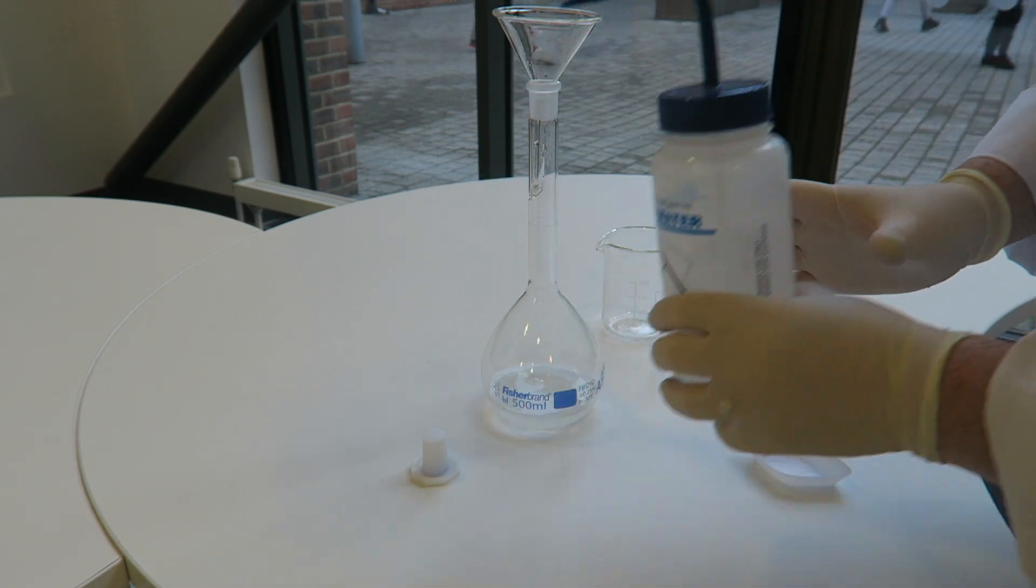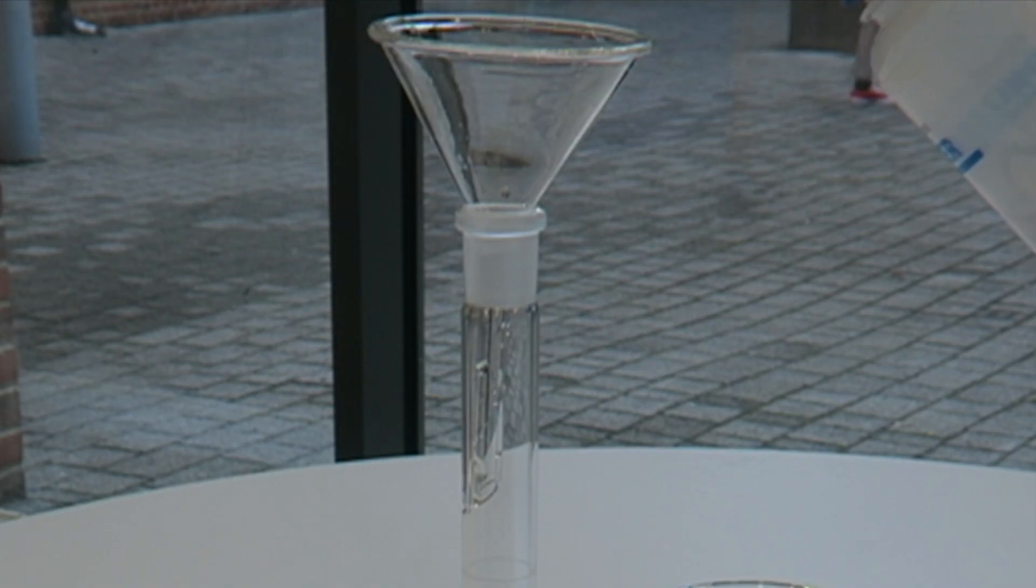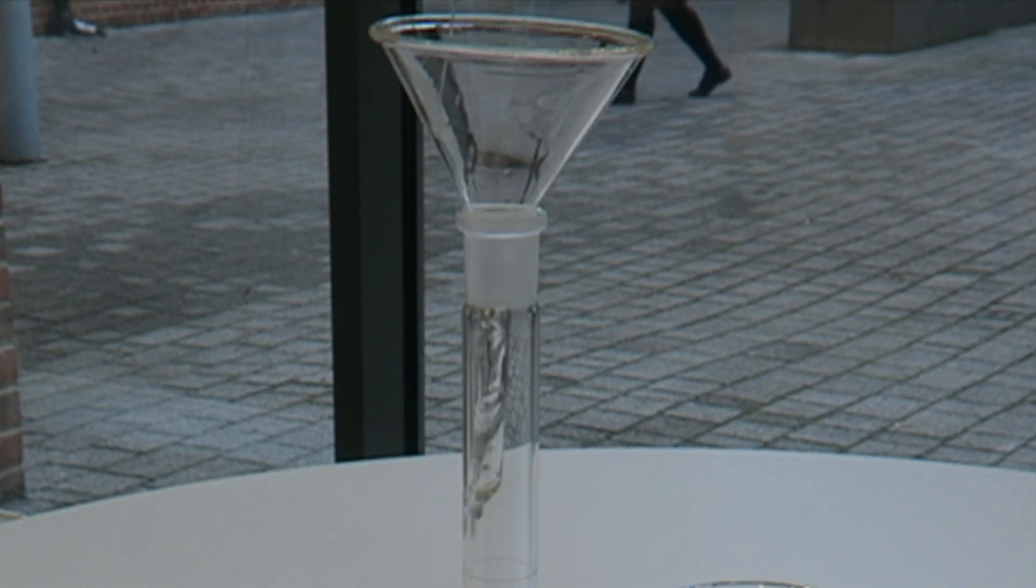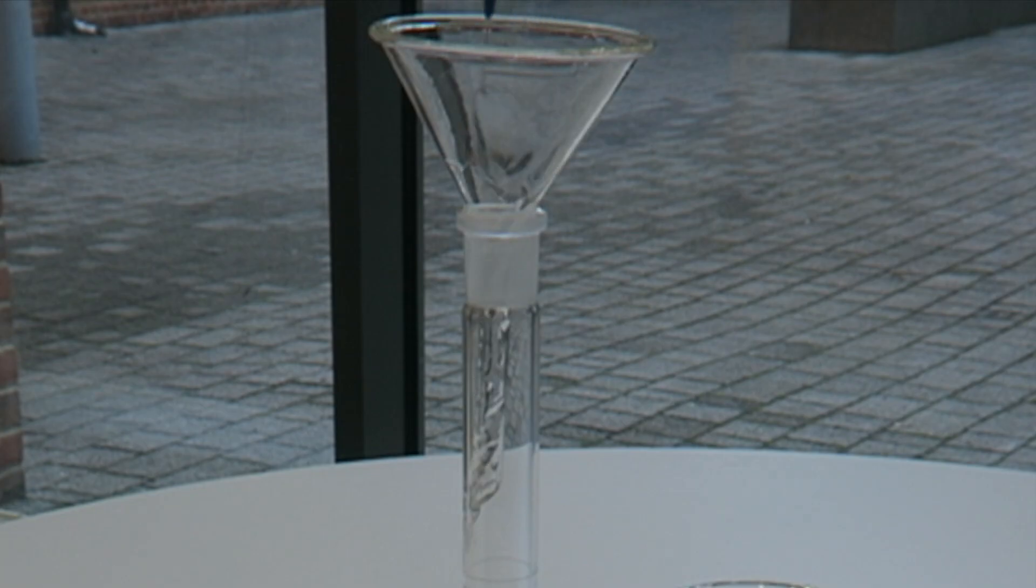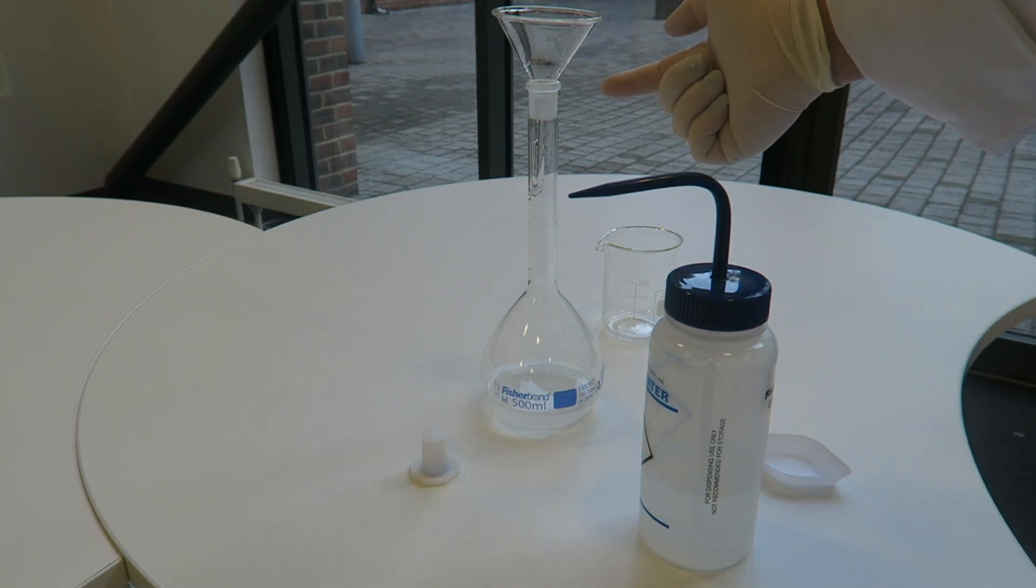Once we've done that, we then need to do the same to the filter funnel. So rinsing the filter funnel to make sure that any residue that was in the filter funnel ends up in here.